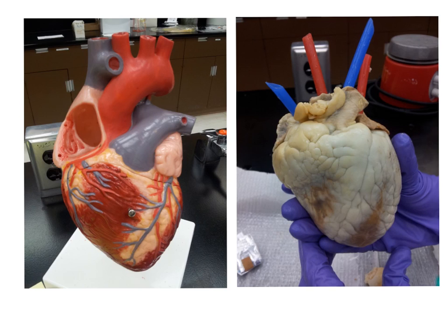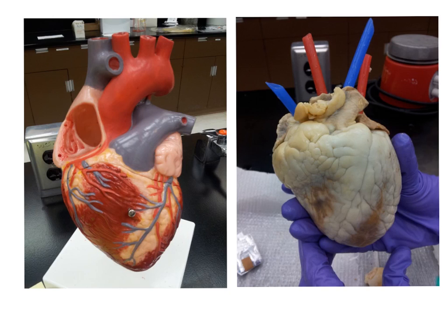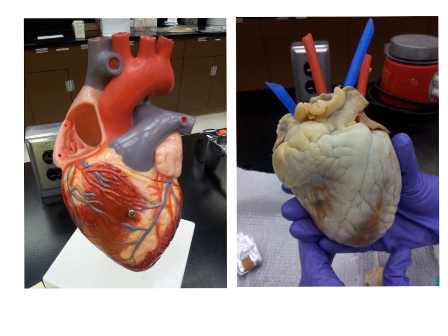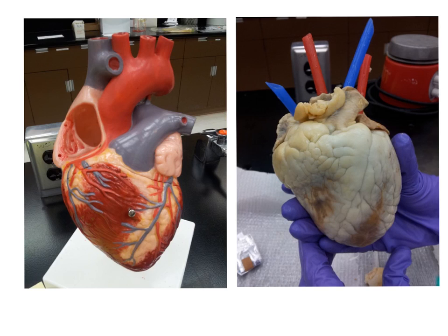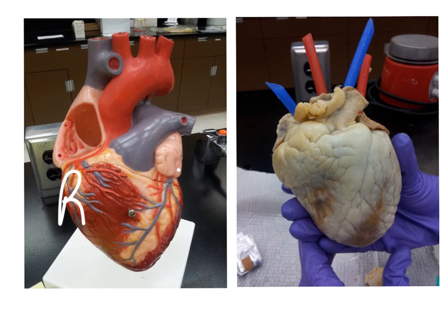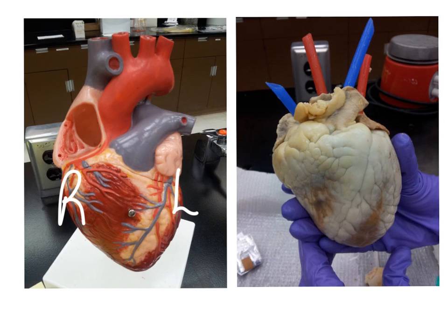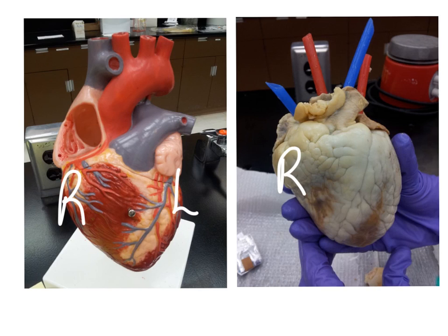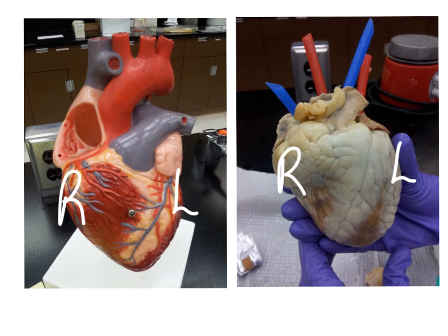Now that we know which is the ventral surface, we can determine which is the left and right side of the heart. If this is an anterior view, we know that this is going to be the right, and this is going to be the left.